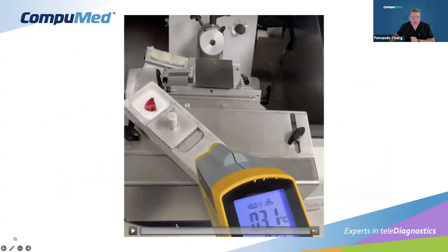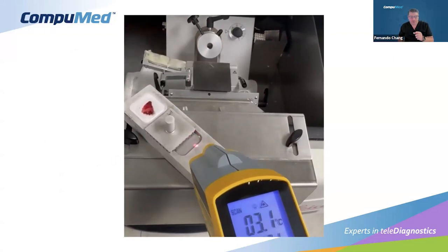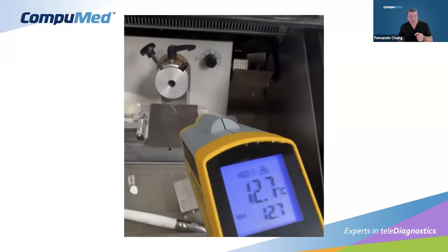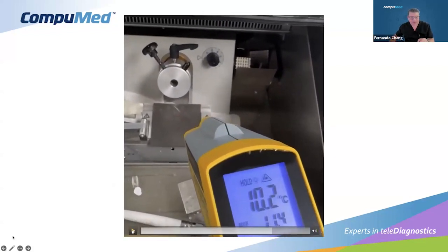Okay, we have a video here, and I took the video just to show the different temperatures that we have. For instance, the sample block is -12. Now that's the stage, and I want to stop by there, because the stage is really hot, and then I realized, why is this temperature so hot?